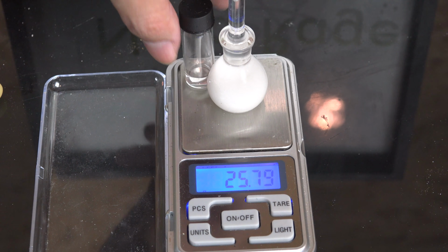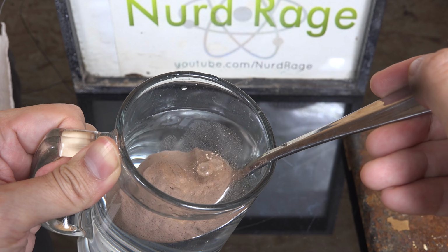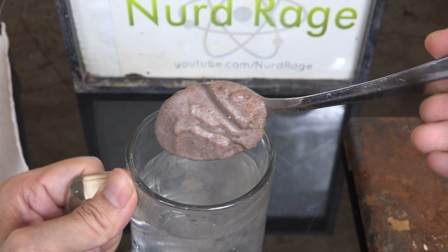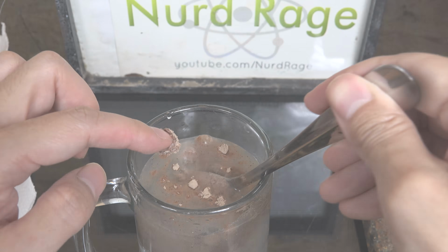As great as it is, it doesn't always work. Finding an insoluble liquid isn't always easy, and the surface tension of the liquid may prevent it from penetrating the gaps of the powder. You've probably seen this when trying to mix baking ingredients. The water doesn't penetrate the surface and seems to make a bubble. For these cases, professionals use a much more sophisticated system.